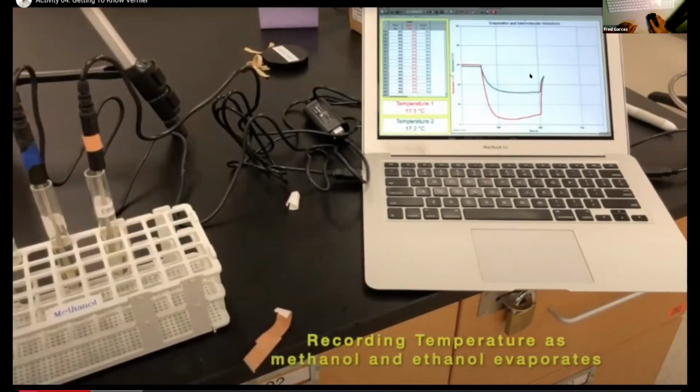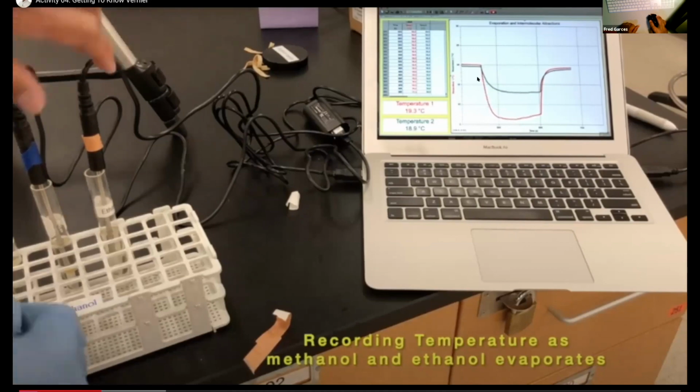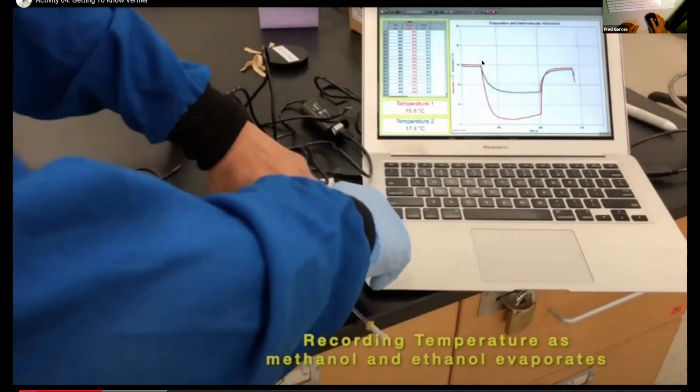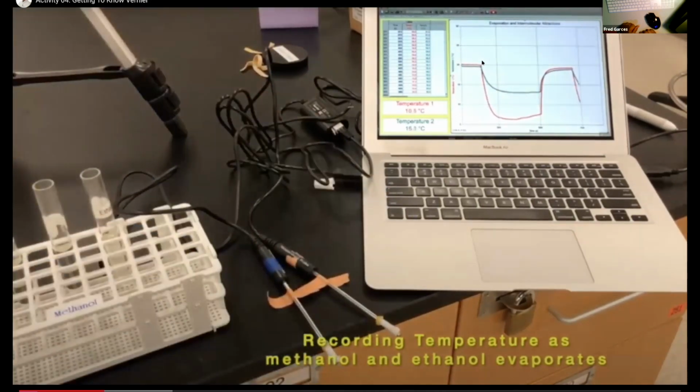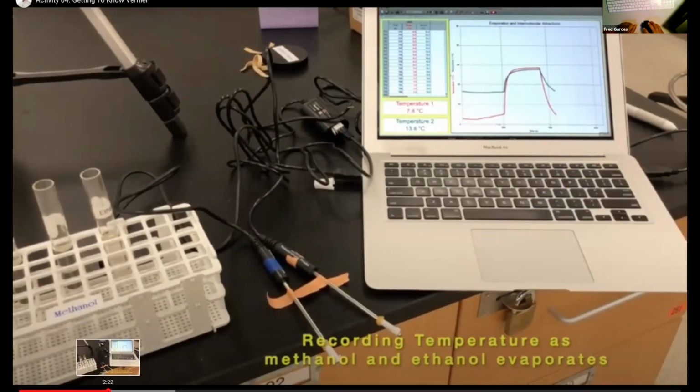And what I did, of course, was I went back, took those things, and put them back into the alcohol. That's why it's gone up. It's gone to that temperature again. And then I'm going to do a second trial. What I'm doing is looking at the temperature difference between the lowest and where I start. And here it goes again. So that's the data that you guys are recording for this experiment right here.